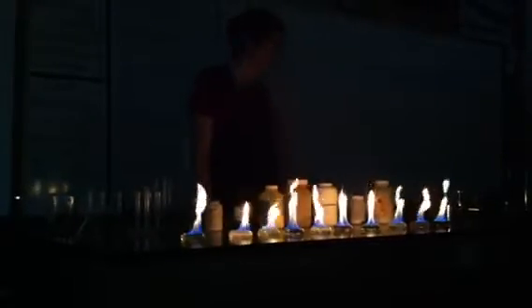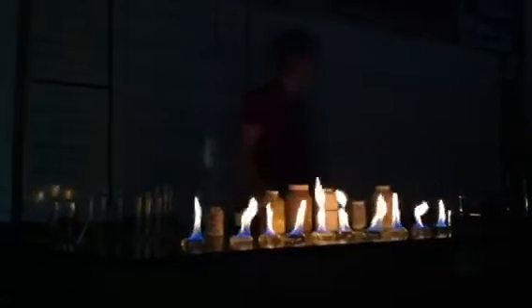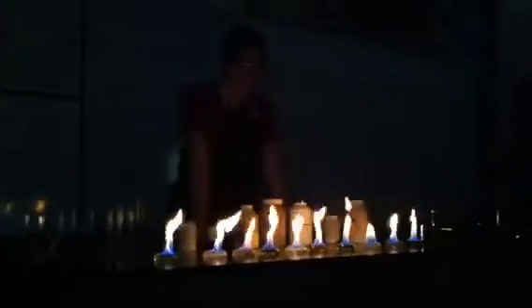We're only burning 10 milliliters — it's going to go away in a bit. This is such a great way to spend a half day. I'm watching flames. This is what I go home and do — I watch fire. It gets better! Voldemort's going to come out of that green one. Didn't you say it was like five feet high or something? So we've got some very clear yellowy oranges.